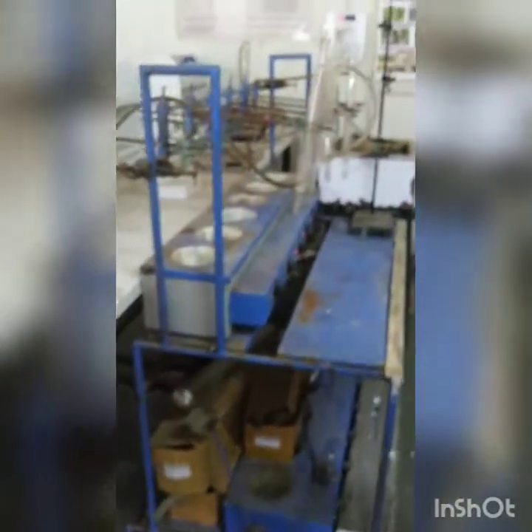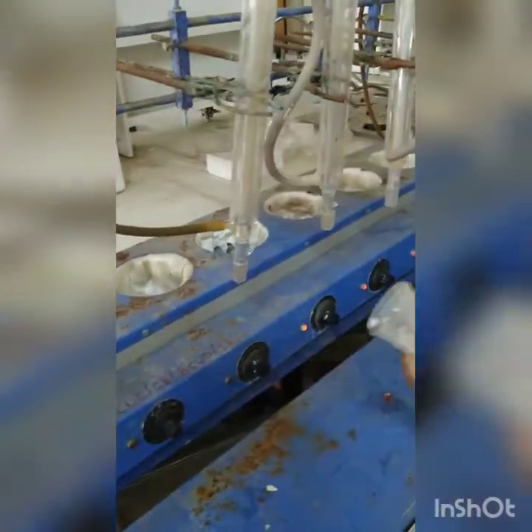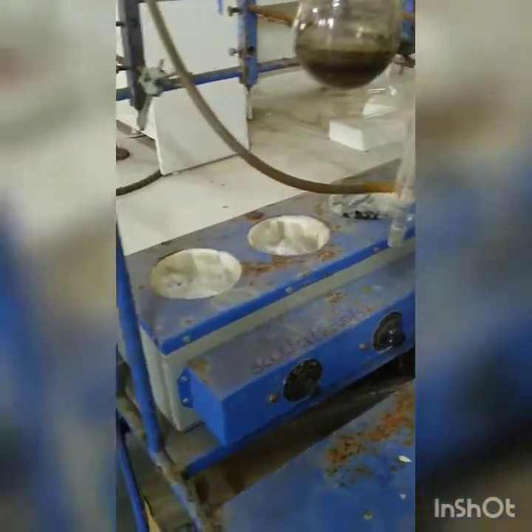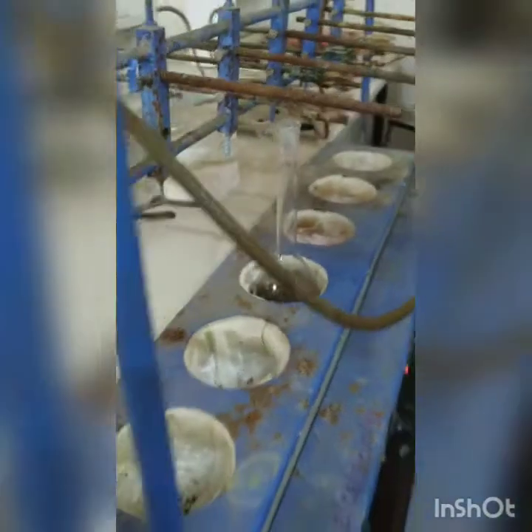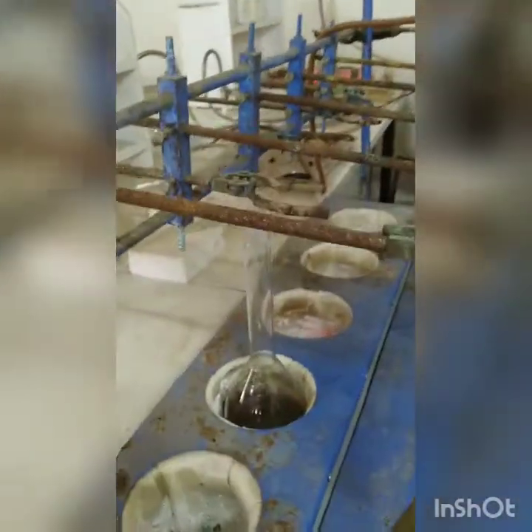So we will fill those 2 distillation flasks also, rather digestion flasks, and we will keep it in the assembly for digestion for half an hour. So Ingole sir, you keep it for digestion for half an hour. Just put that flask there for heating. Yes. Okay, now we are going to keep it for digestion for half an hour.